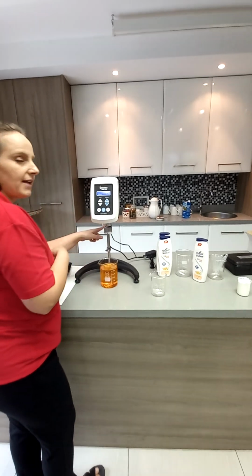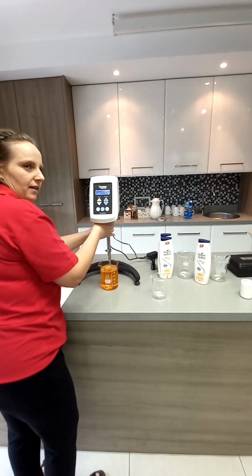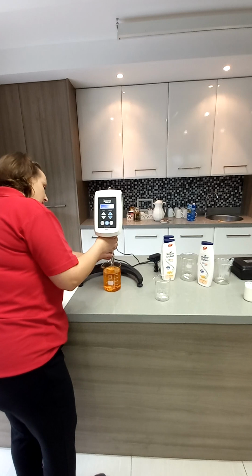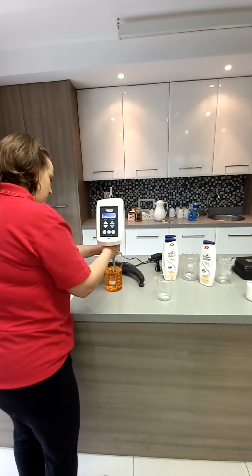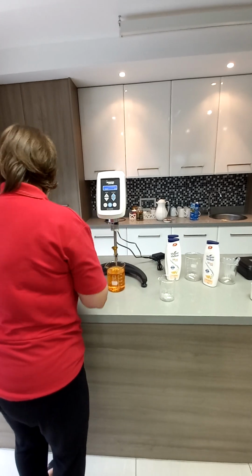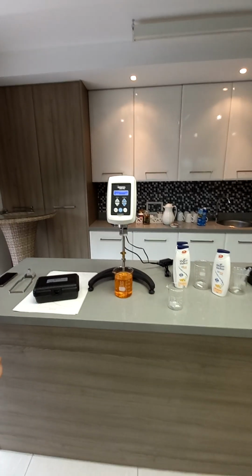When you lower, this is the helipath stand. You press this lever and then you can lower it. Make sure to hold your hand underneath the viscometer so it doesn't fall. You have to guide it down, but I'll let you practice. Just let it go down. And then I'm going to show you one thing. It's good to have something underneath. The helipath never goes down enough if you use it with the normal spindles.